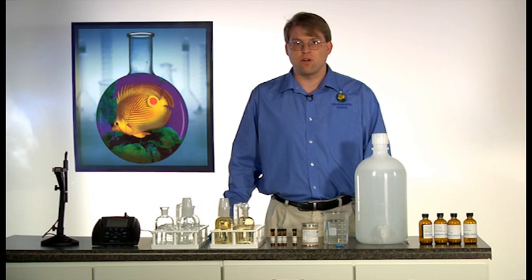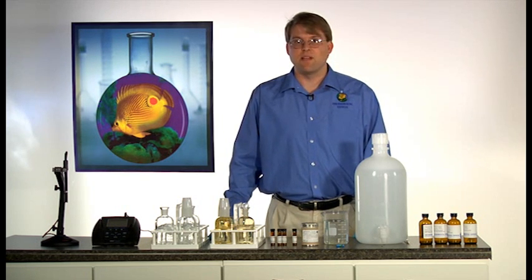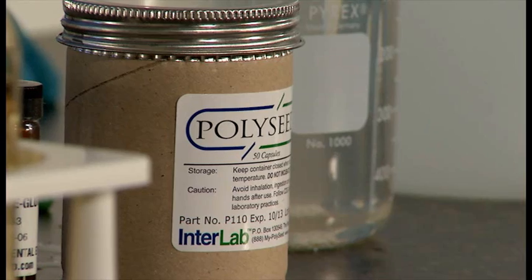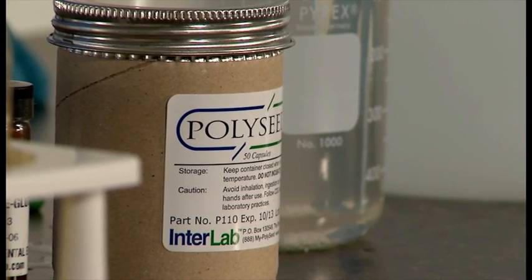After the seed has stirred for an hour, allow the bran to settle and decant the liquid from the top. Your seed solution is now ready for addition to your sample bottles.